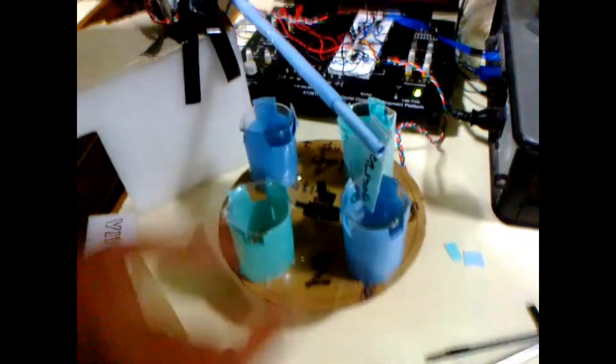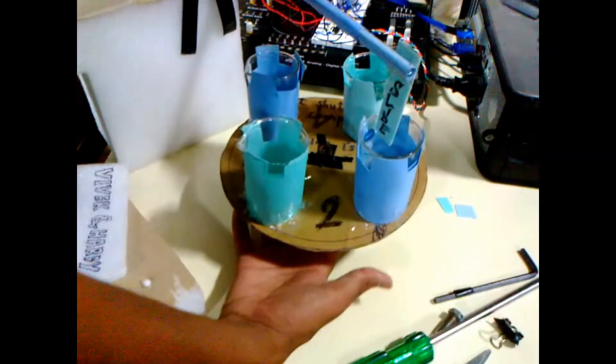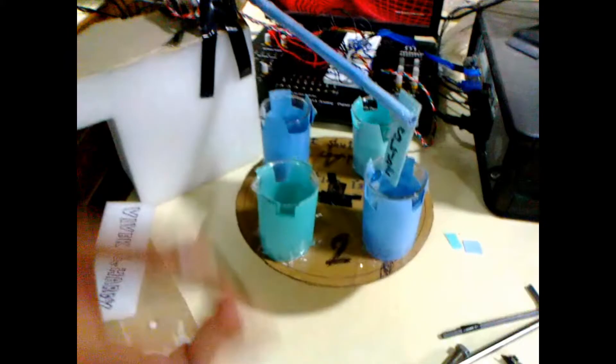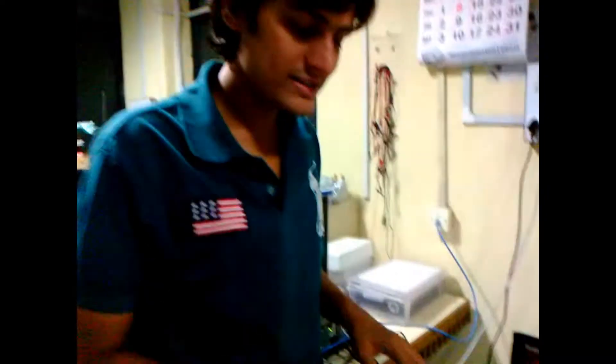Simultaneously, both motors — the lower one and the robot arm — are calibrated along with time. You can see the live demo now. We are inserting the parameters into the program.